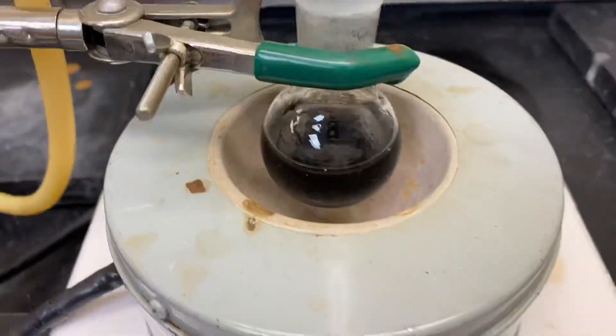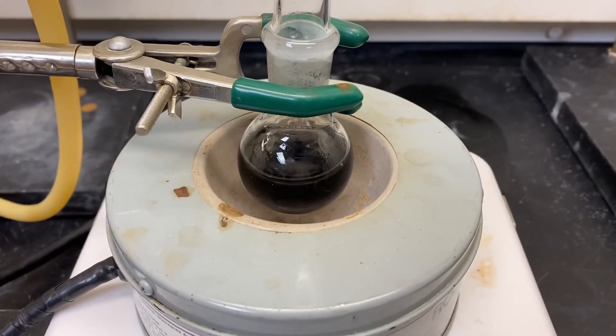Heat the mixture until it is refluxing, then reflux the mixture for 20 minutes.